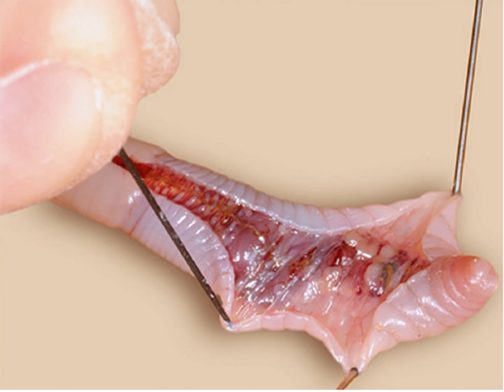Pin placing is to keep the body wall apart, and the angle of the pin should be oblique, so that while observing the internal organs these pins should not come in your way. And then we have to separate each septum from the alimentary canal using a teasing needle, and pin down each loosened bit of skin throughout the individual.